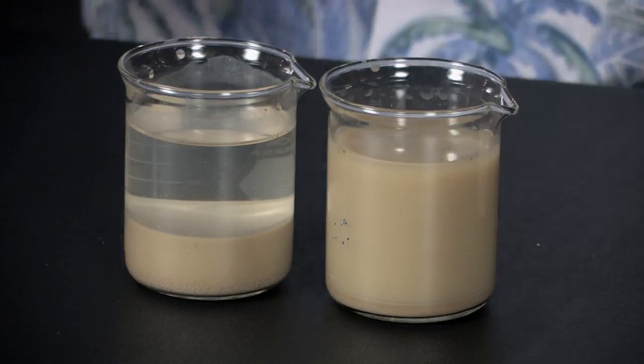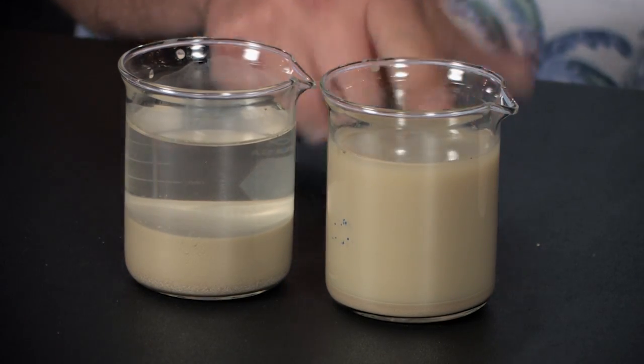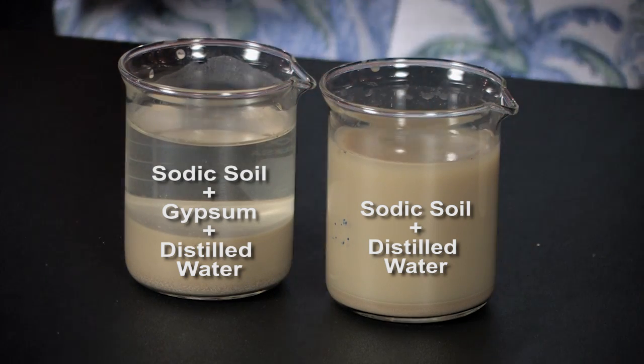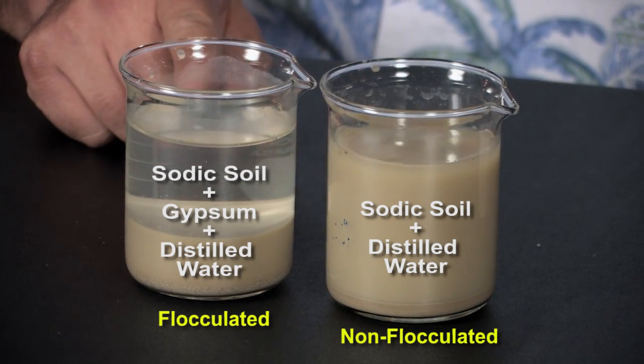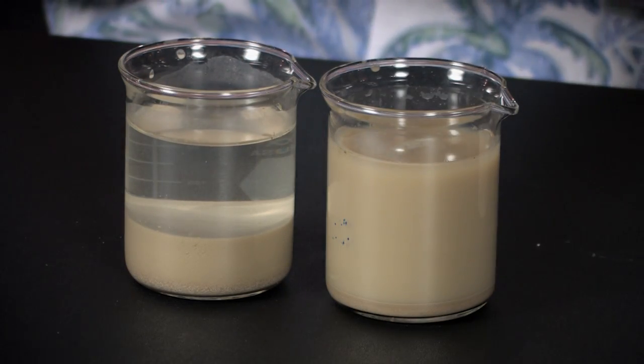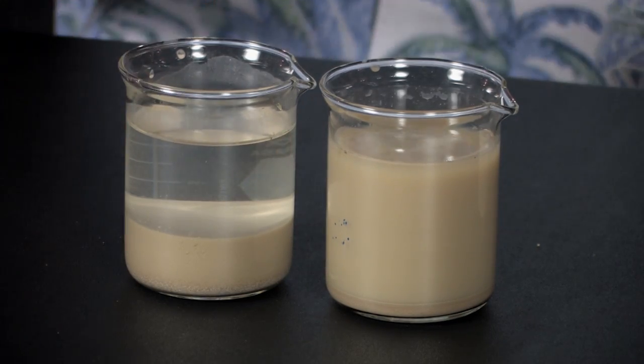It's been about a half an hour since we stirred this up and let it settle. You'll see that the one that just has water — this clay has stayed suspended. The clay particles are acting independently; they're dispersed. Where we've added calcium in the form of gypsum, that's allowed the clay particles to get close enough together to clump into aggregates, or to flocculate. Now the aggregates are much bigger than clay, they act more like sand particles, and they've settled out.